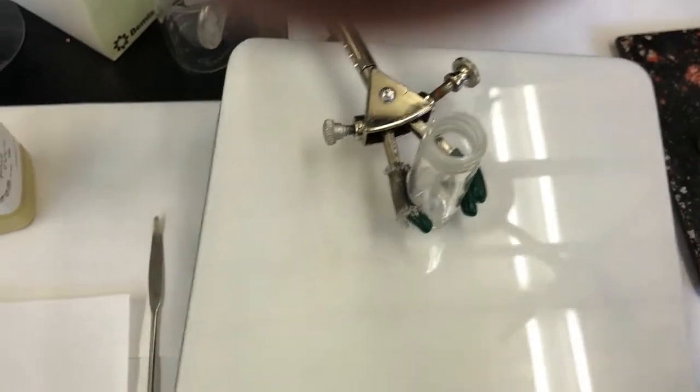Okay, so there's a little bit more about that. When you spot it, if you want to be more accurate with the time, let's say I want to do the time for 10 seconds, right? So I add the sodium borohydride, start the timer, and then when it's at about 5 seconds, I can dip my capillary tube into it, and now it's 6 seconds, 7 seconds. What's going on is that this capillary tube is a glass tube, kind of like our glass conical vial. So the solution that I draw up into it, it's still continuing to react, even when it's taken away from the conical vial. So at 5 seconds, I pull some of the reacting solution out, 6 seconds, 7 seconds, 8 seconds.